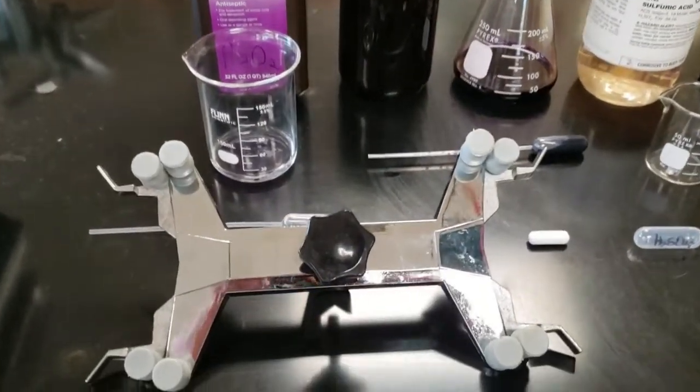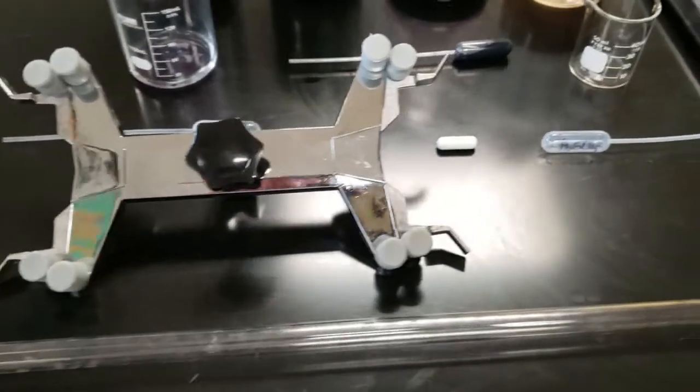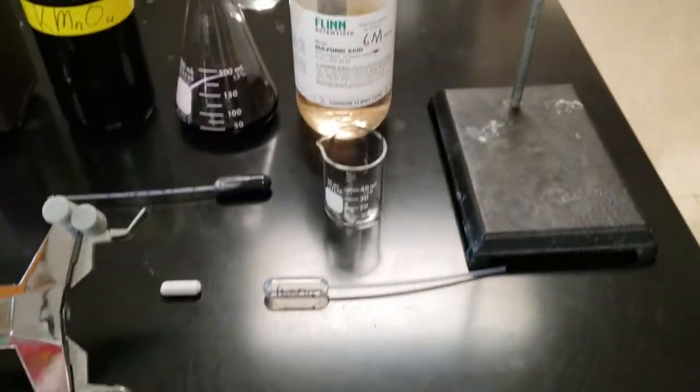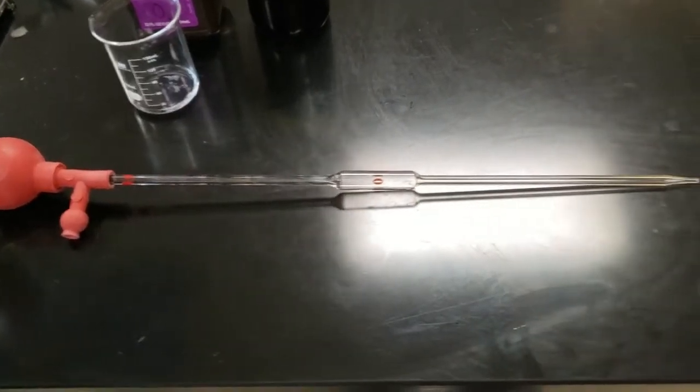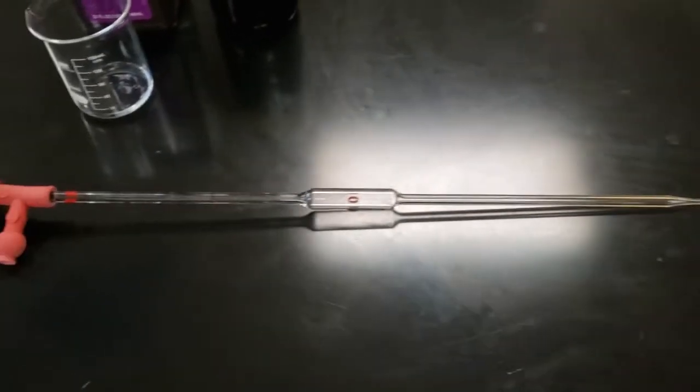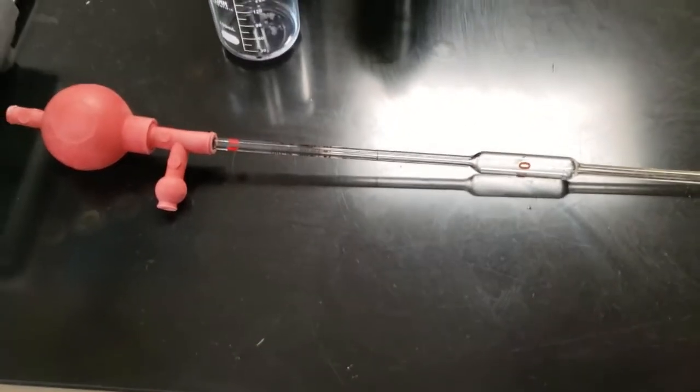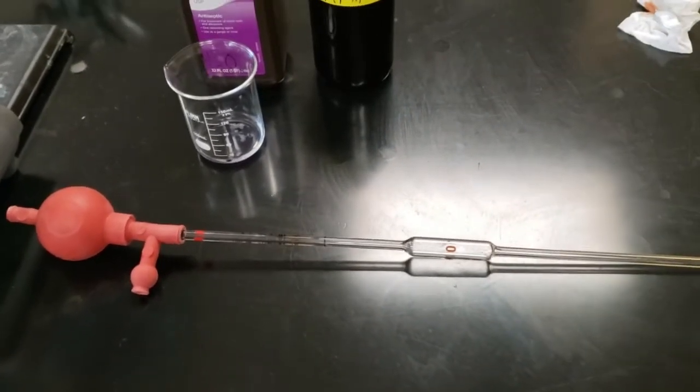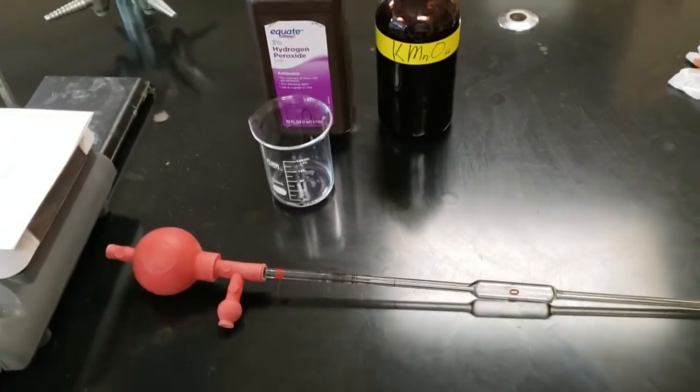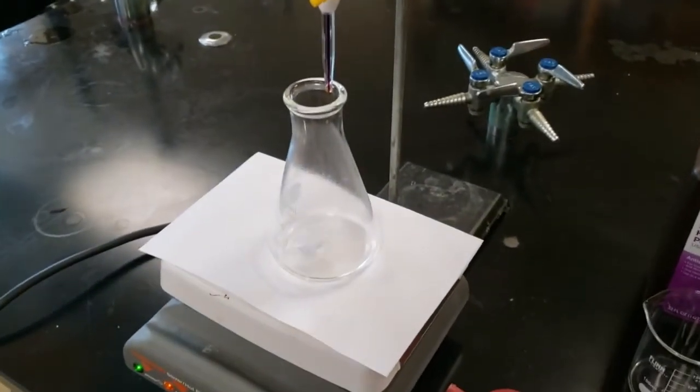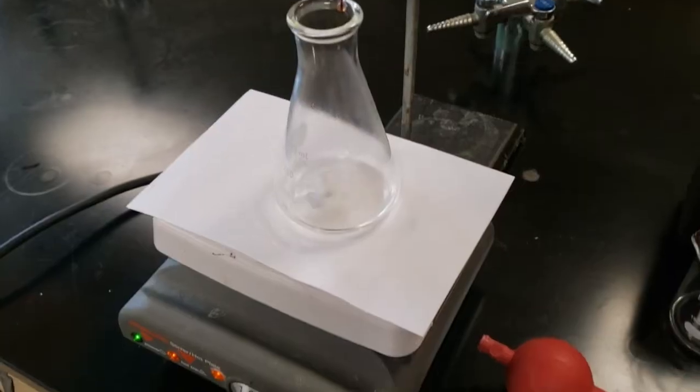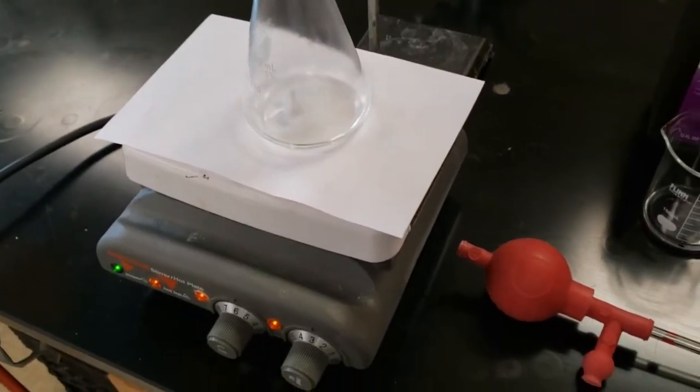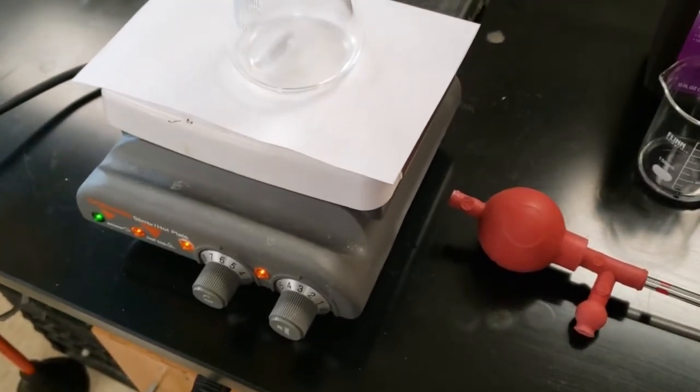What is going to be shown is a 10 milliliter pipette. We're going to plop in the stir bar and add a big squirt or two from a disposable pipette of this sulfuric acid. So in the Erlenmeyer flask, which by the way keeps it from splattering so much, you have the 5 milliliters of the peroxide and a couple squirts of the sulfuric acid.